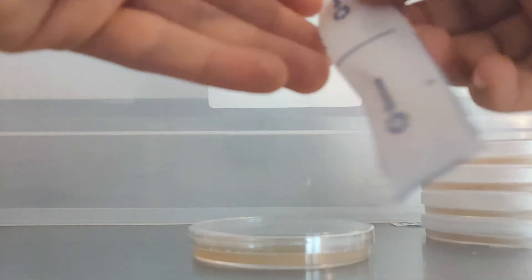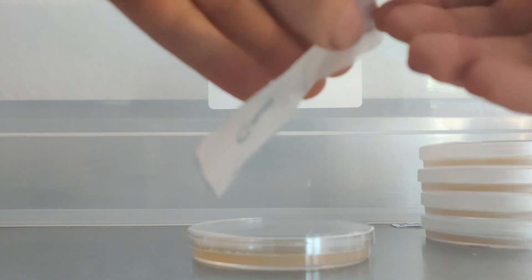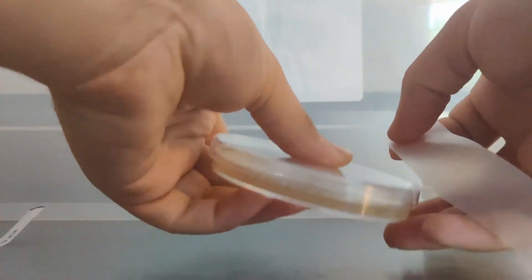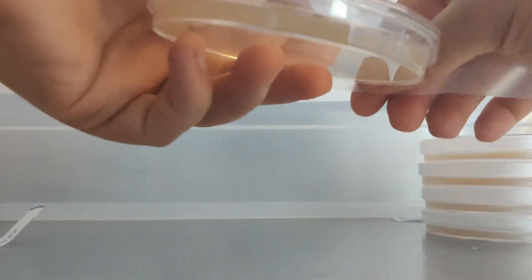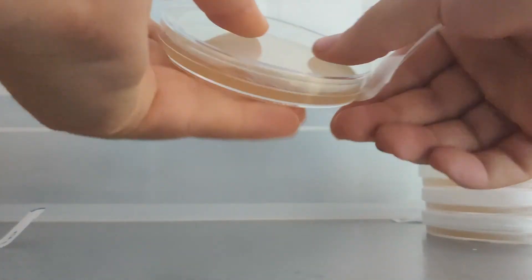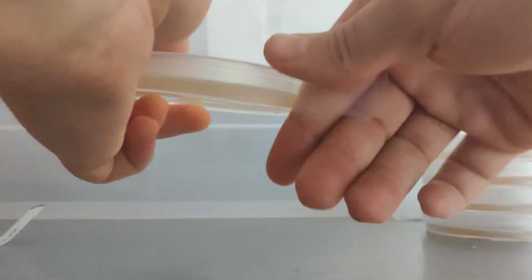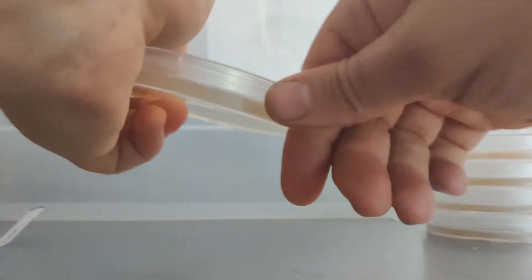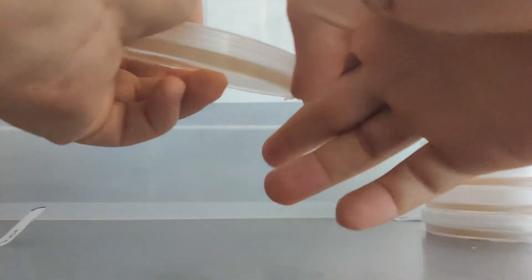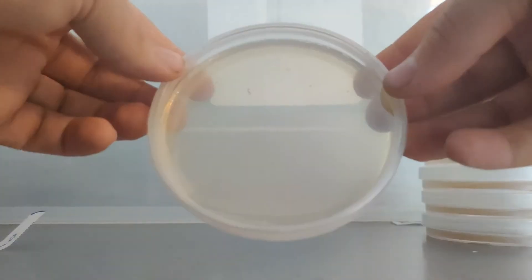Once your plates have cooled, use them immediately or seal them for short-term storage. And the process is complete. Thank you.